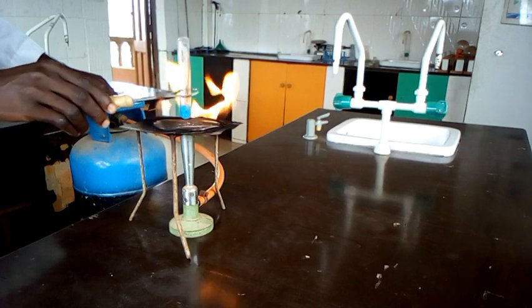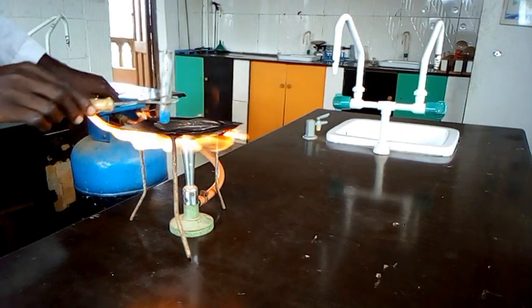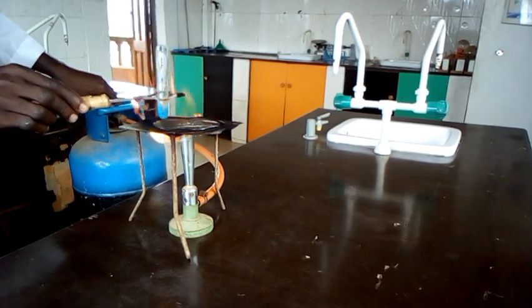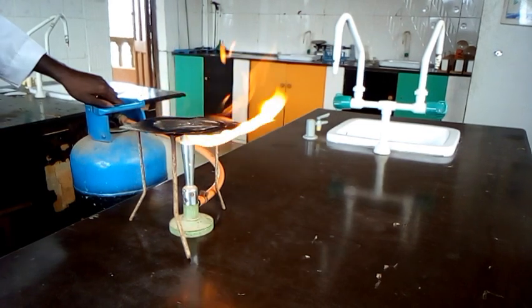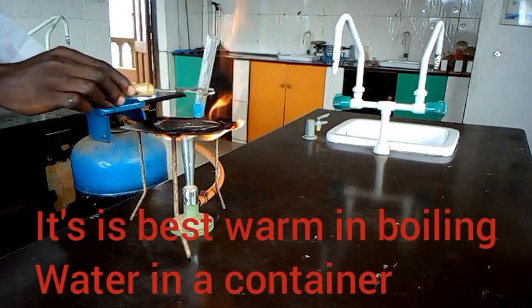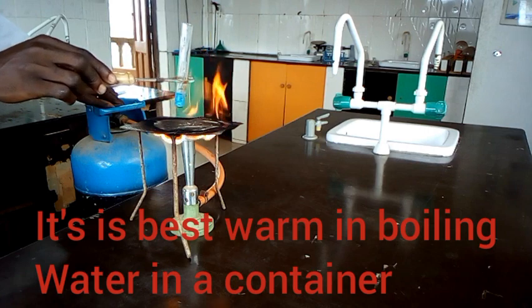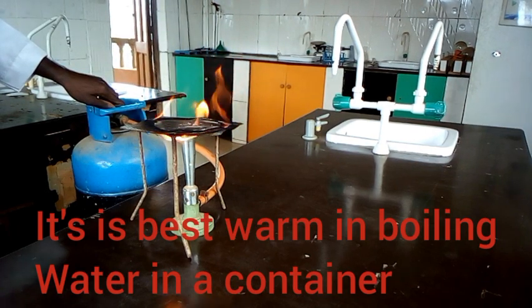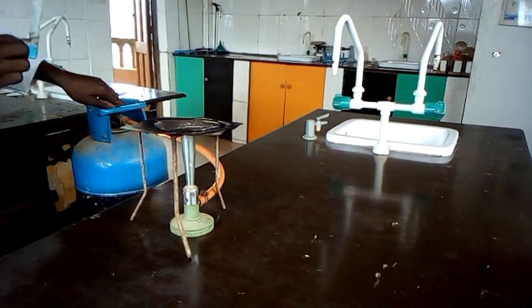Okay, as I'm warming, I'm perceiving a gas here, and I suspect ammonia gas, and this gas will turn damp red litmus paper blue. Wow, that's ammonia gas. So when you put damp red litmus paper, it turns it blue, and at the end of the day, ammonia will be confirmed. Okay, and it has a choking smell. The gas does have a choking smell.